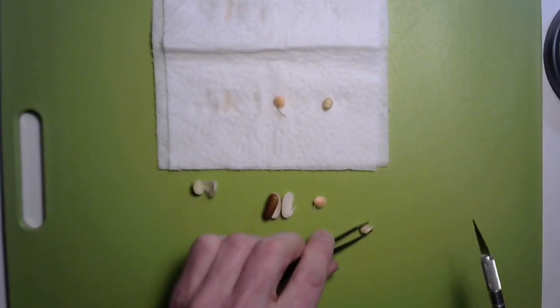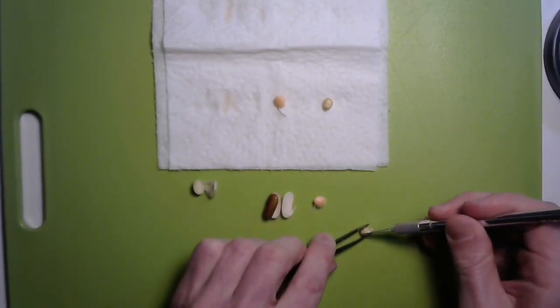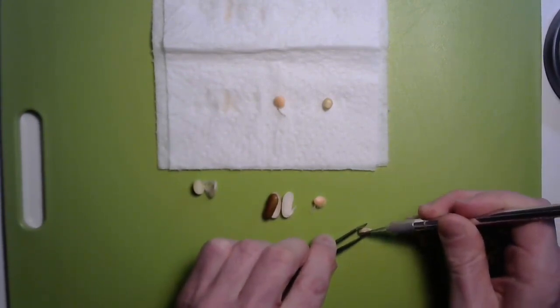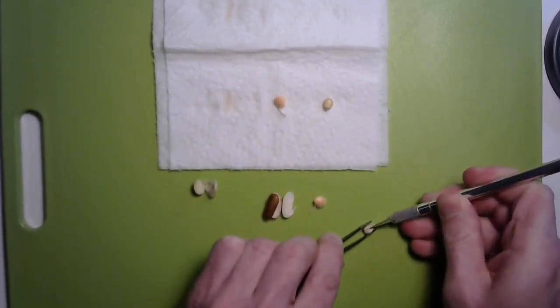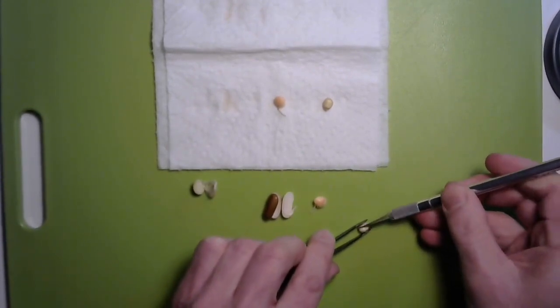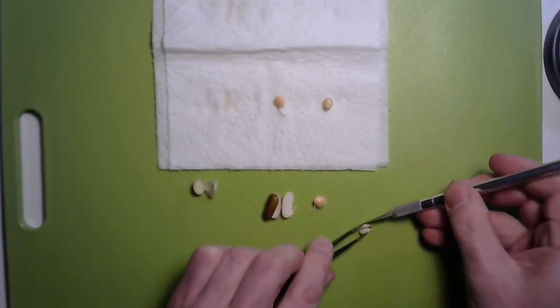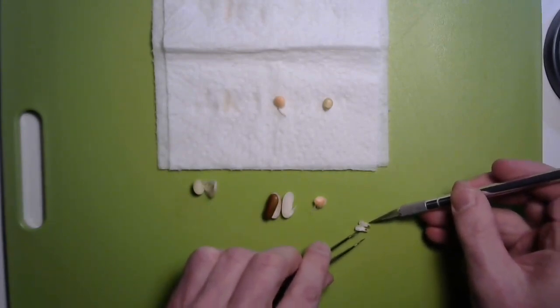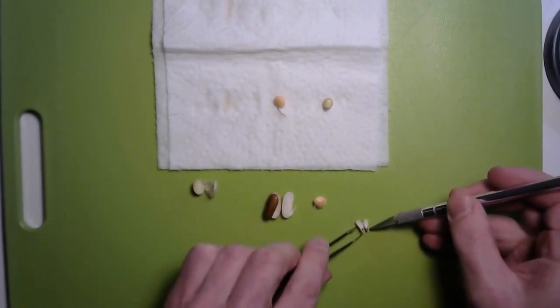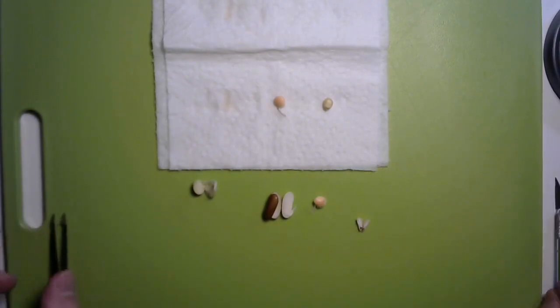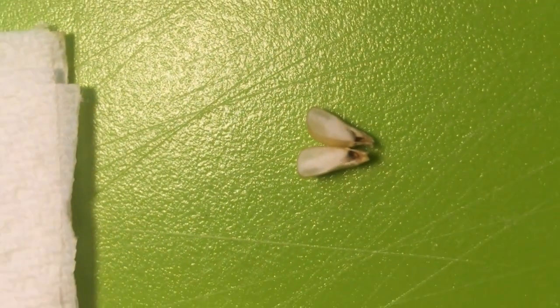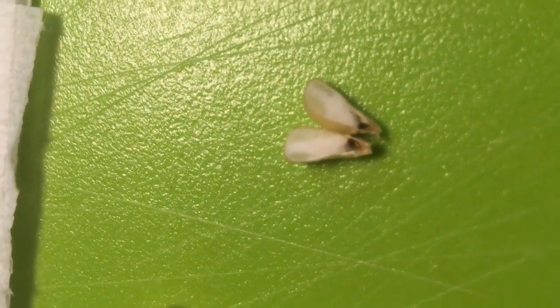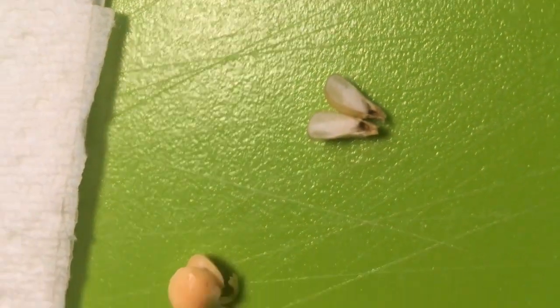This one I can fit in my tweezers very easily, and it is very hard to cut. There we go. All right, so I cut it into two pieces, but that was not very easy. But oh, we can see the parts. You can use your magnifying glass, and I'll show you with my high quality camera.